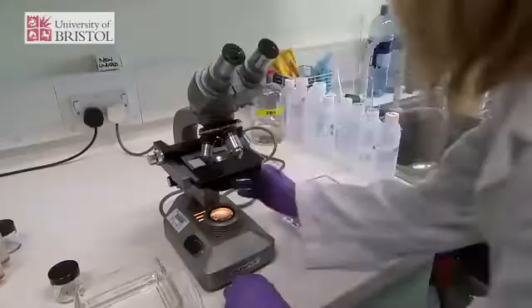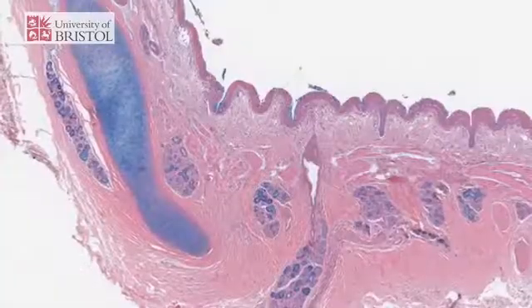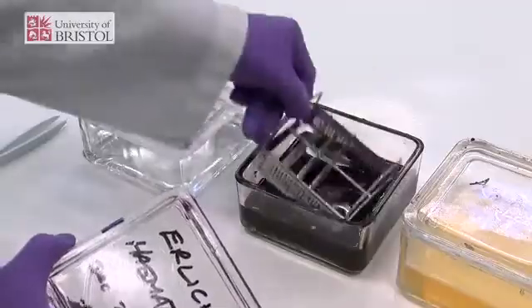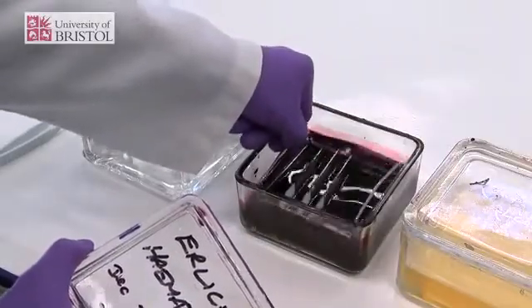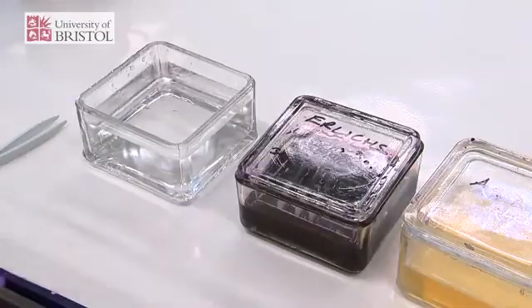We need very thin sections so that we can look at them down the microscope — it allows light to pass through the section so that it can be viewed. We need to stain the tissue because very thin sections of unstained tissue in its natural state don't have any innate colour, and so it's very hard to make out anything when you look at it down the microscope.